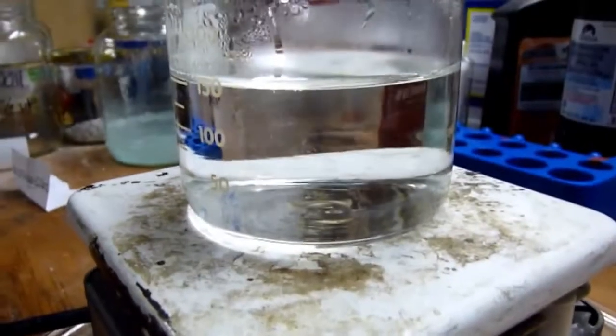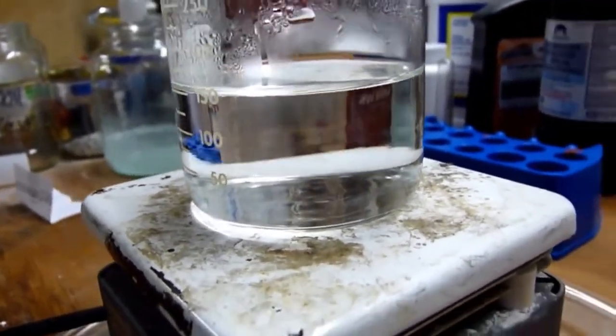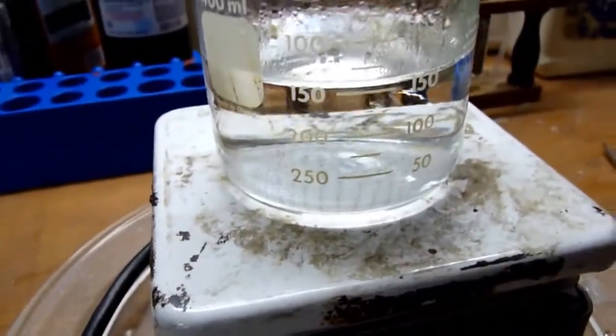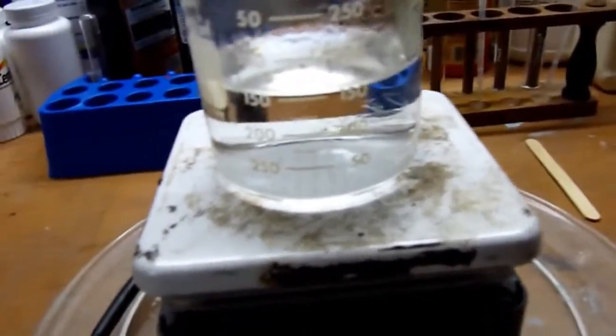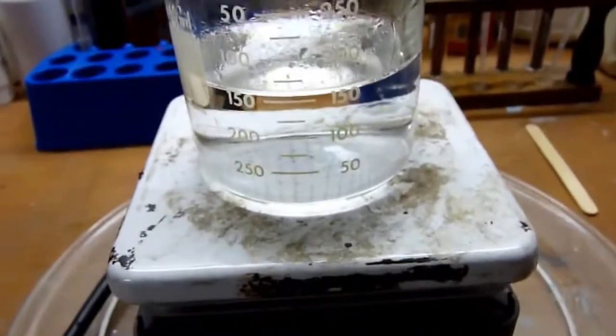Anyway, there's some very fine bubbles, as you can see in the solution. And that's just the hydrogen peroxide decomposing. That's normal. That's about a normal rate. You'll notice if I get any little piece of dust in there, you'll definitely see it'll be a little stream of bubbles that'll follow the dust particle around. And it'll cause significant decomposition.